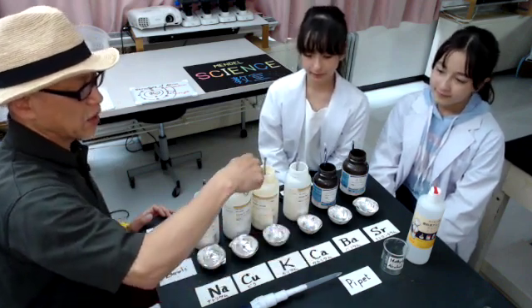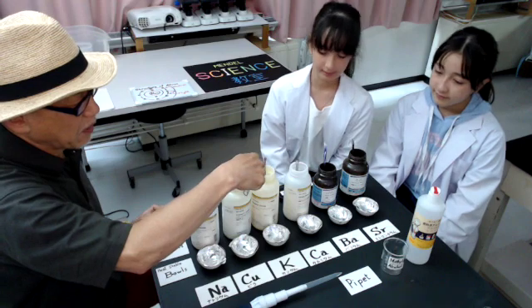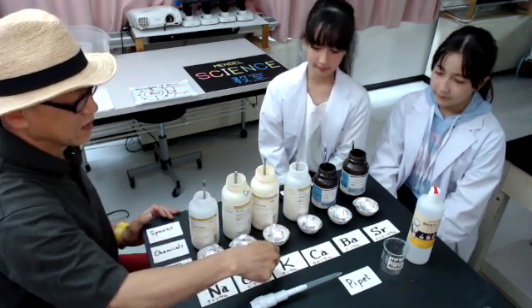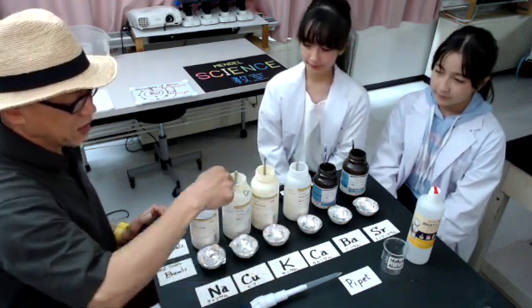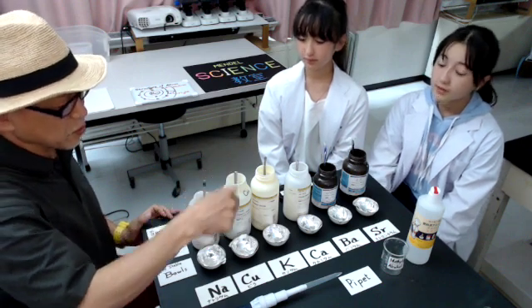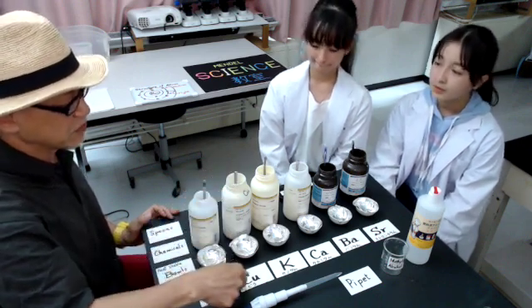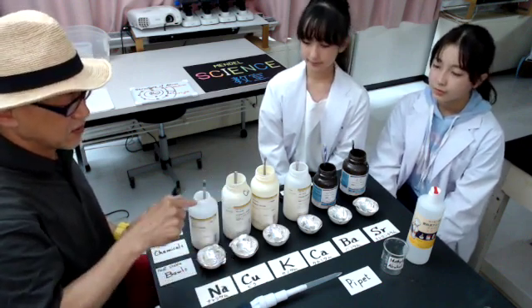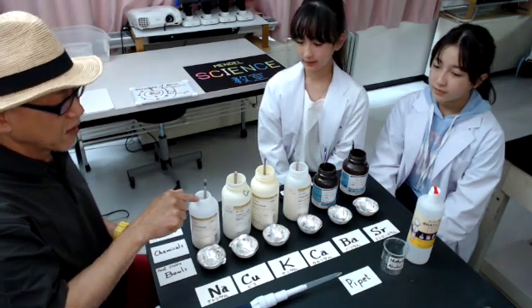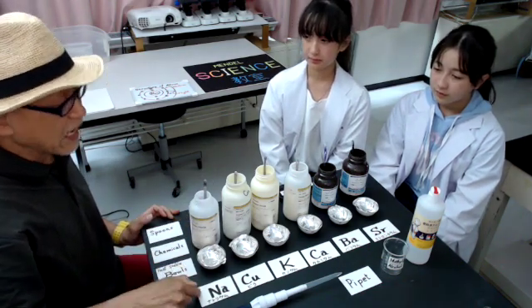This chemical is potassium, symbol is K. This chemical is copper, symbol is Cu. This chemical is sodium, symbol is Na.